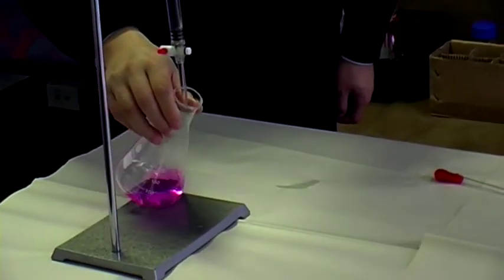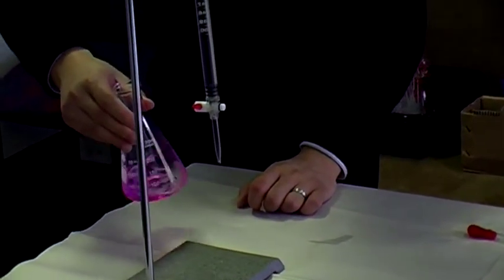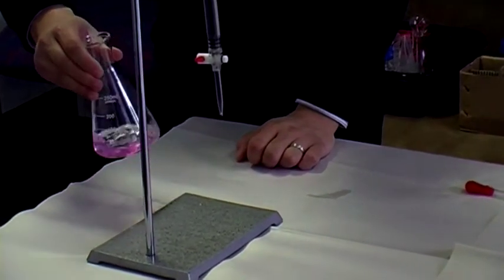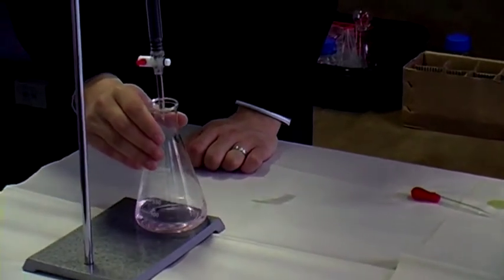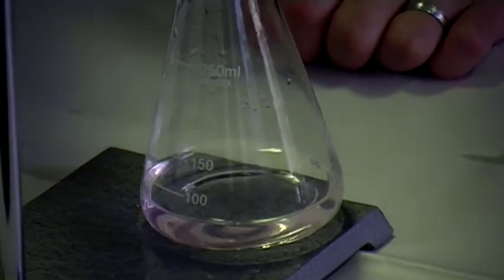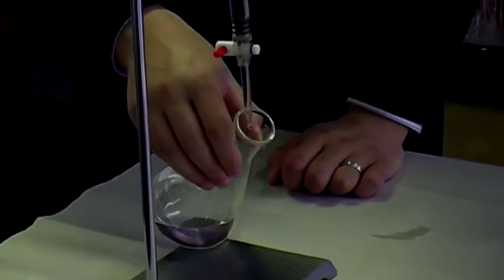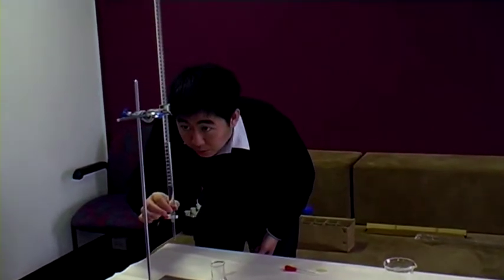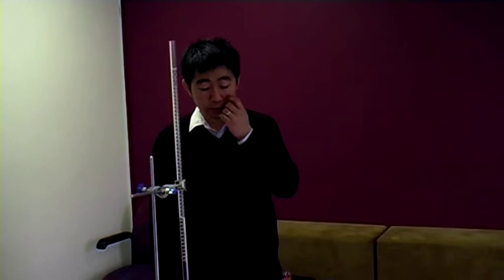It's still basic, so we should be close. Let's add another 2 or 3 mLs. At 37 we've added 22 mLs — still basic. At 38, very close. It's light pink now; it used to be much darker, very fuchsia. I think one more drop will do it. One drop — and it's clear. We got down to 38.1, which starting from 15 is 23.1 mLs for our rough titration. I'll write that down.